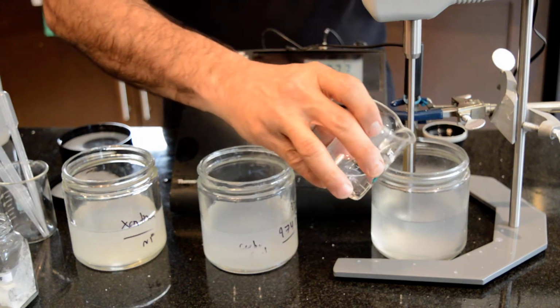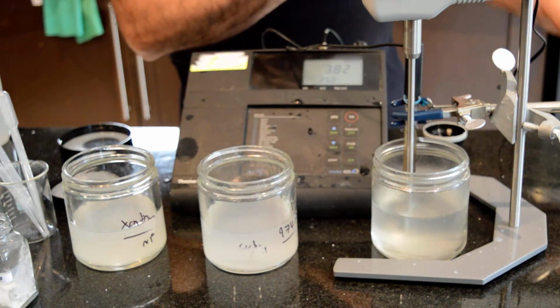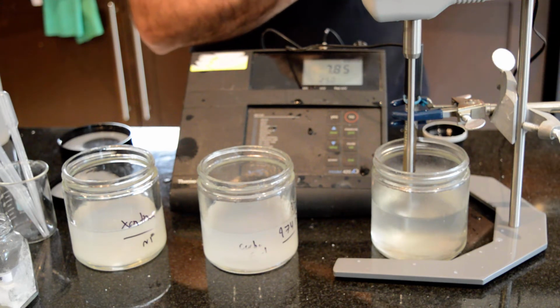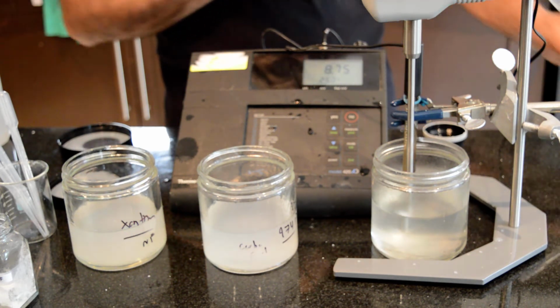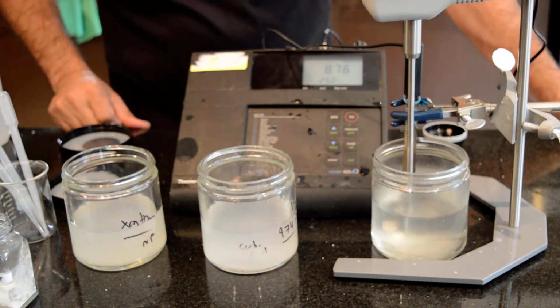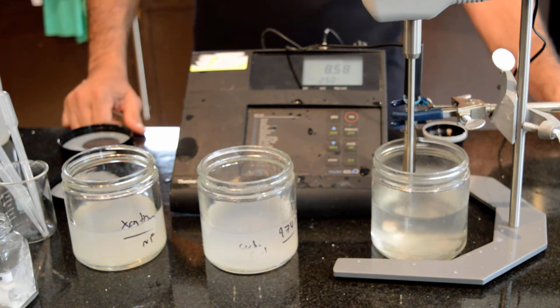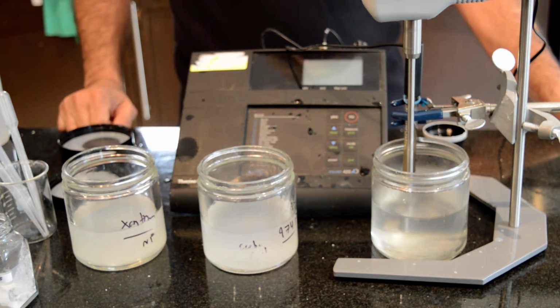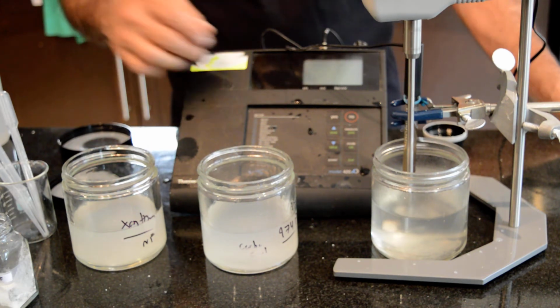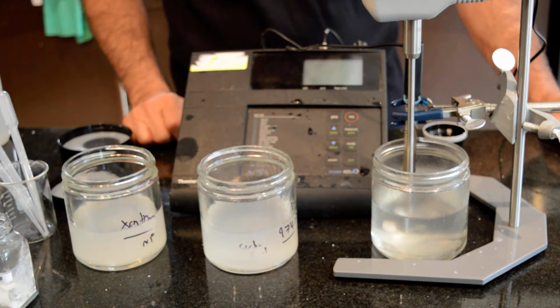This particular alginic acid is the NF grade, and they actually come in different viscosity ranges, and as I recall, some of them are low viscosity, some are called high viscosity, and so on. So it seems like I overdid it. Suddenly the pH increased to 8.7, but that's fine. All I needed to do is to demonstrate that the alginic acid does need the pH adjustment in order to form a gel.